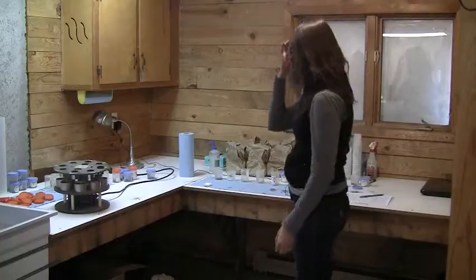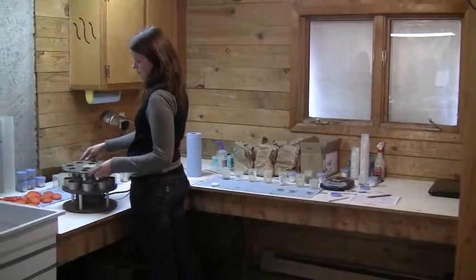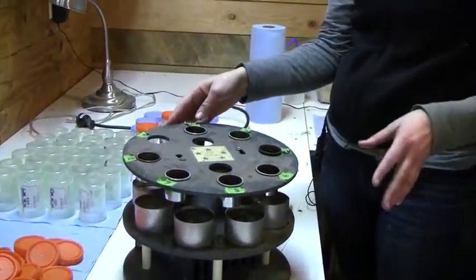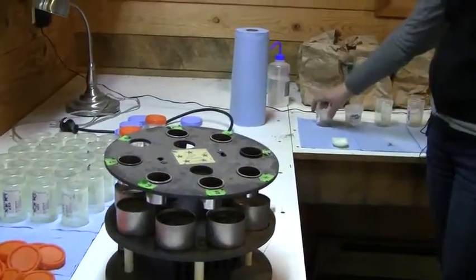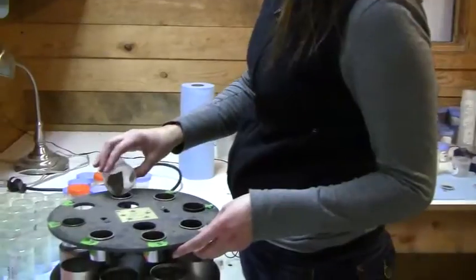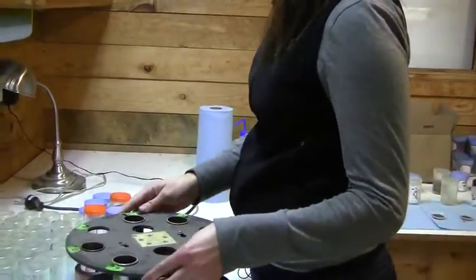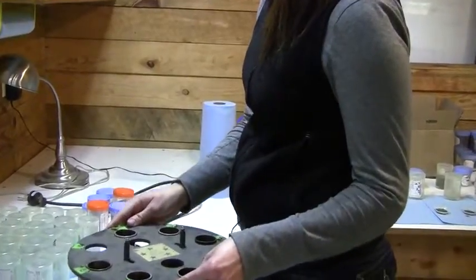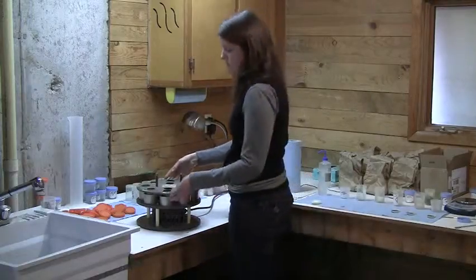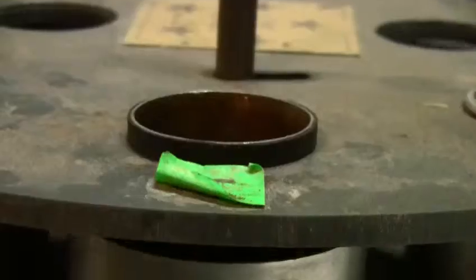We do that using the wet sieving apparatus. The idea behind this is that unstable aggregates are going to be disrupted by water. So we take an original soil sample and dump it into one of these sieves, and then this machine gets turned on and it gets dumped into a cup of water. The machine moves up and down, and we keep those samples in there for about 5 minutes.